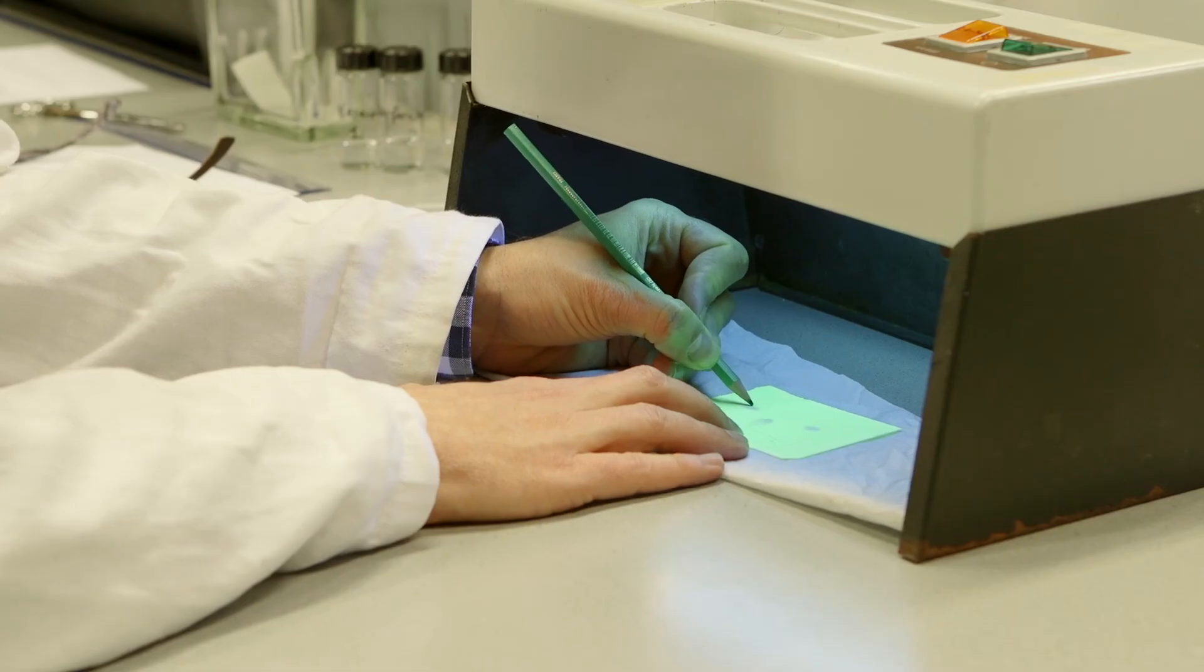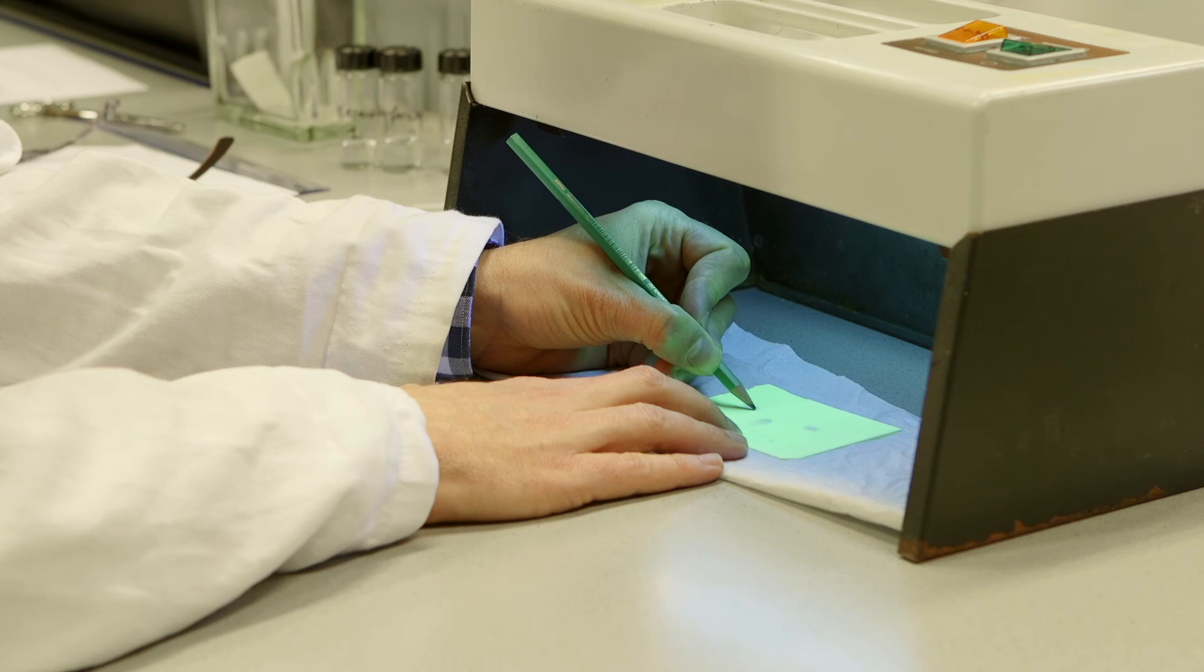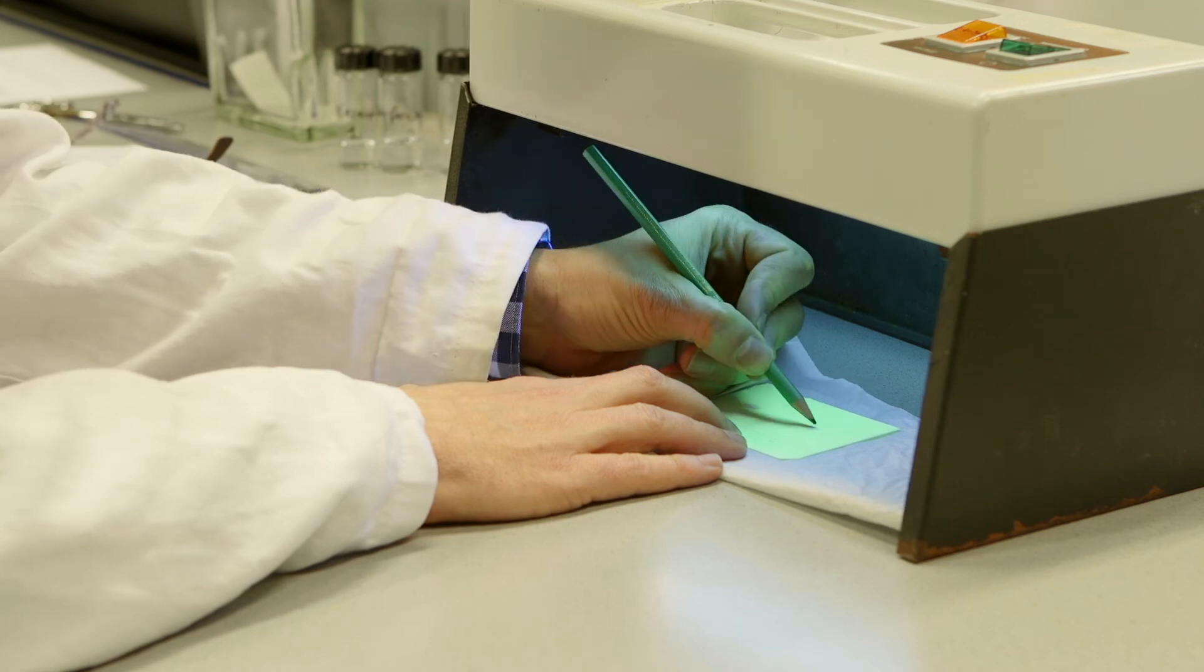With a thin pencil line, the circumference of the spots is traced. This is best done with a long pencil so that the skin is not exposed to radiation.